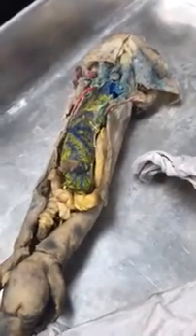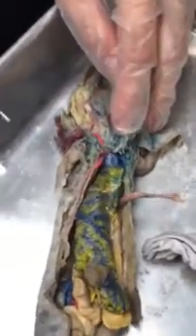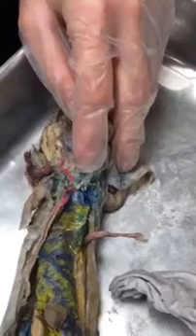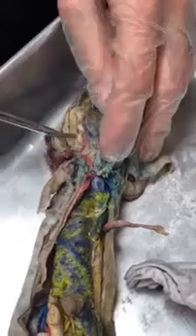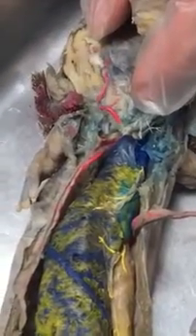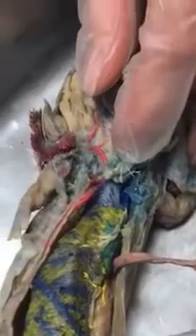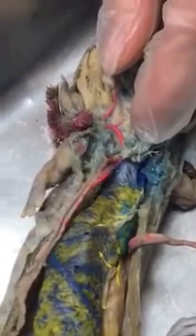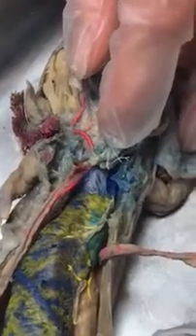Cross off external carotid artery. Can't see it in this one, but you have internal carotid artery. And a bunch of these are really easy to see on page 155 of the new version of the spiral bound. It looks pretty much the same. So you can see the internal carotid artery right there. And then you can see on here the efferent branchial arteries and the pulmonary artery and where they connect. So that area is shunted either to and from the gills or the lungs, depending on if they're breathing in the water or the air.